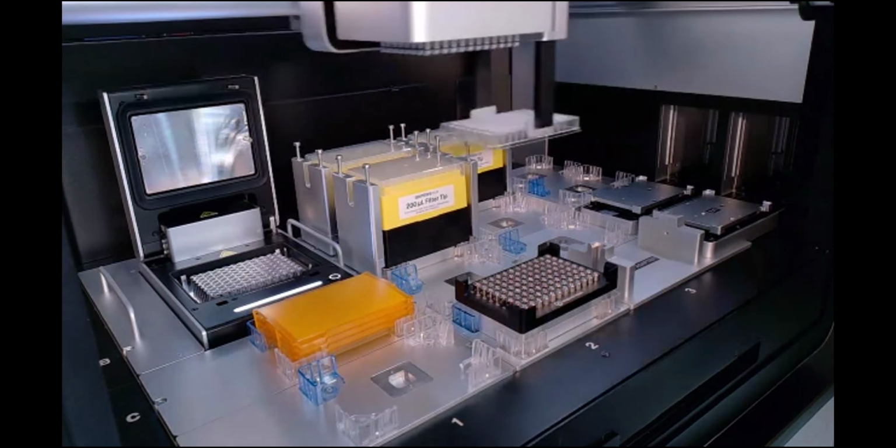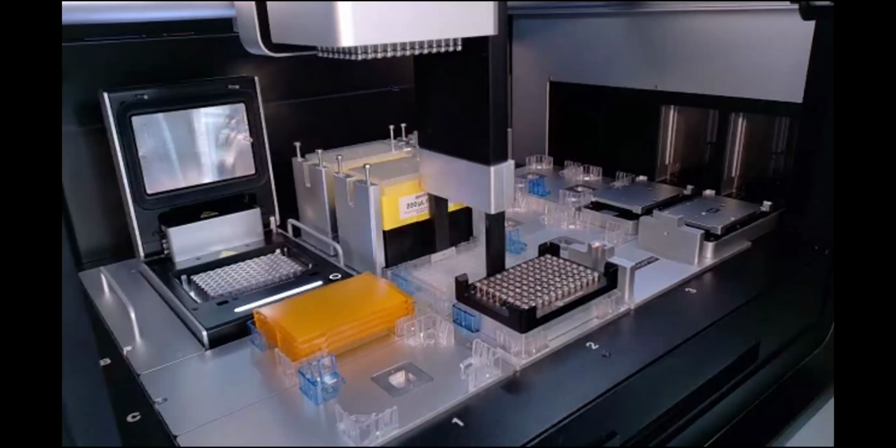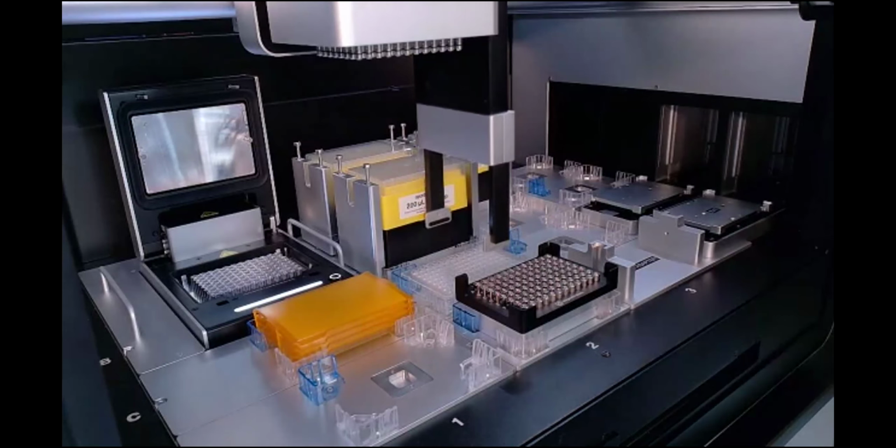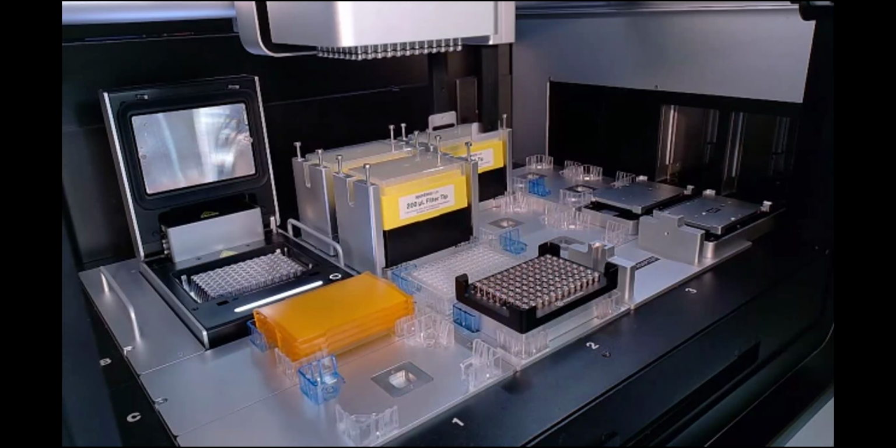Next, it's delivering a variety of PCR plates. As Matt had mentioned, you could have reagents in these and put them in a specific order, or these could just be plates that are going to be used throughout the protocol and therefore just need to be retrieved and moved to the deck.